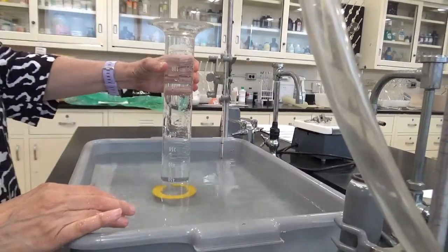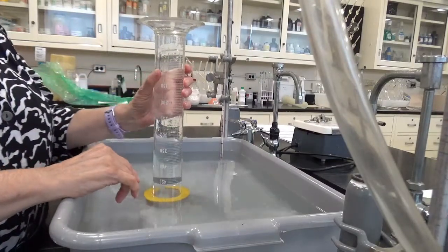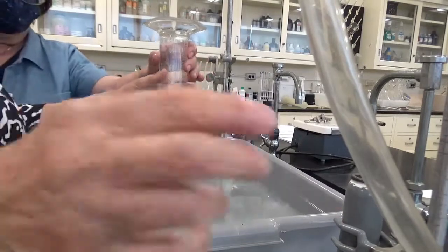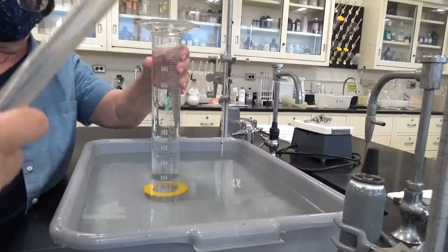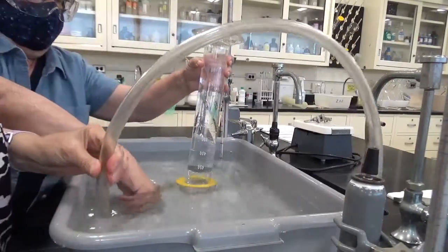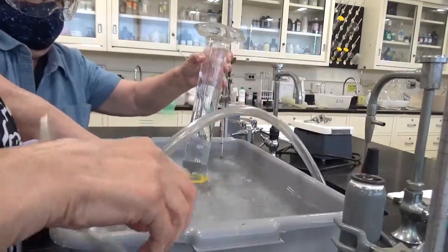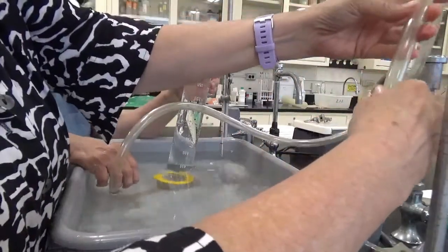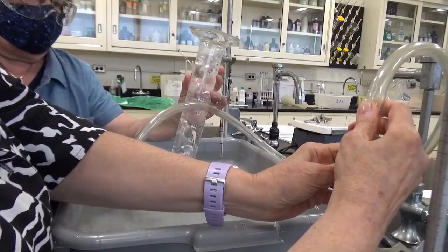This is a graduated cylinder. We're going to get the volume measurement from in here. I'm going to use displacement of water. Yeah, so it takes a village to do this. And I will pass this underneath into the graduated cylinder, and with the other end, I'll shoot some gas in here. Sure. Well, let's try it.